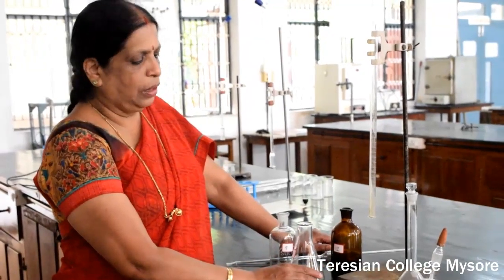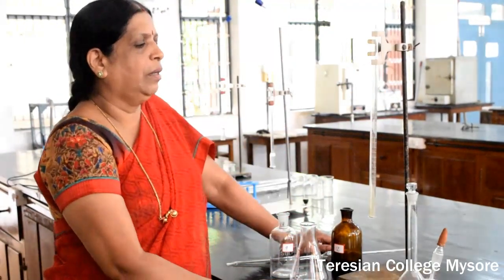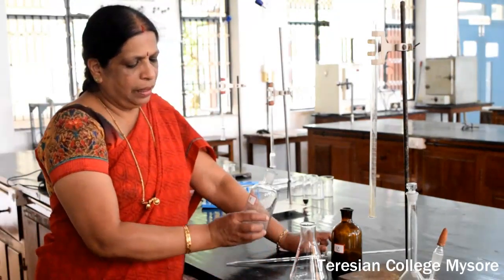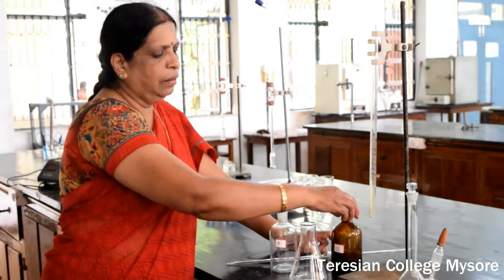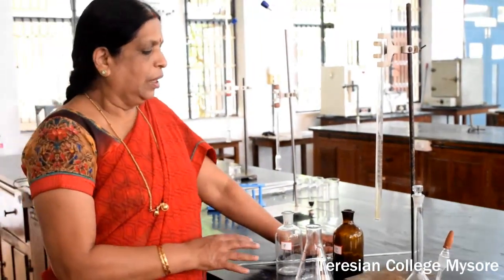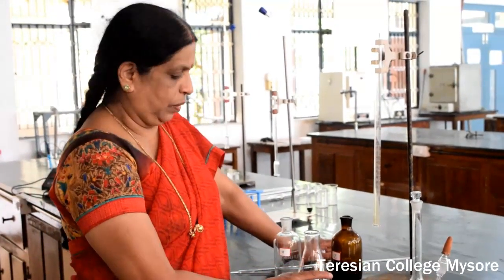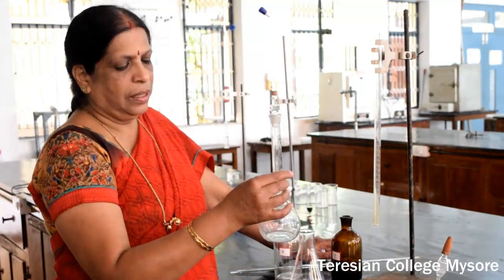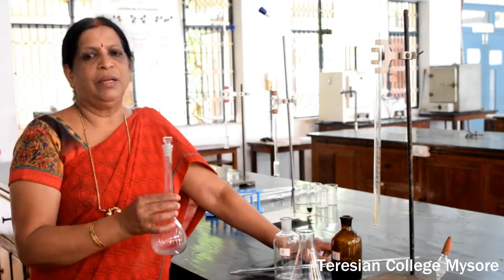After getting the concordant values for the first part, calculate the normality of sodium hydroxide using the relation V1N1 = V2N2. The normality of oxalic acid is exactly 0.1 N. Find out the normality of sodium hydroxide. Once you finish this first part of the experiment, thoroughly rinse your flask and the pipette using tap water and distilled water. Meanwhile, in the standard flask, some volume of unknown solution of the carboxylic acid will be given to you.